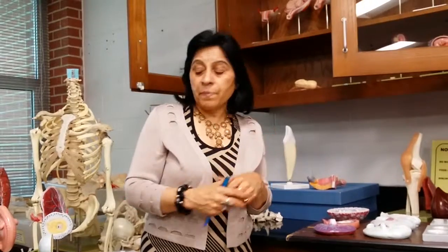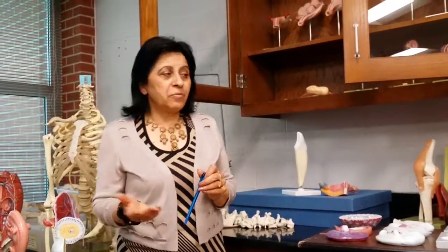So given the model and the slide, identify all these stages. Primordial follicle, primary follicle, secondary follicle, followed by, and that's the sequence in which the stages happen. In the slide, they would not be put that way. You have to look for them wherever, here, there. So Graafian follicle, followed by corpus luteum, corpus albicans, and then the next cycle starts. So the model gives you that, and a larger model will have the same detail. Your figure has that, and then the slide would have some of these stages.